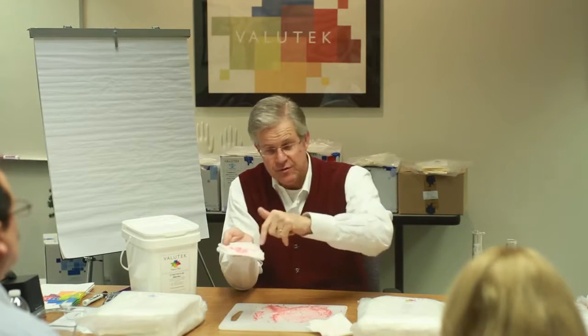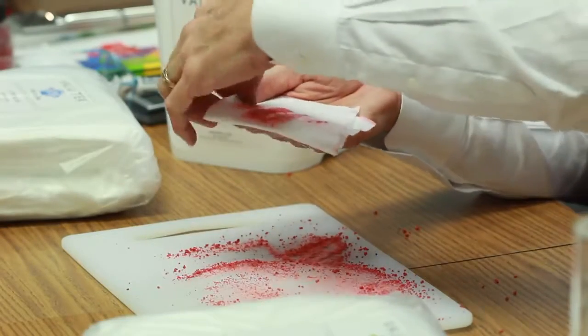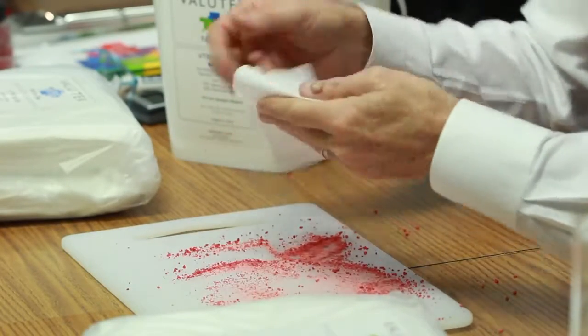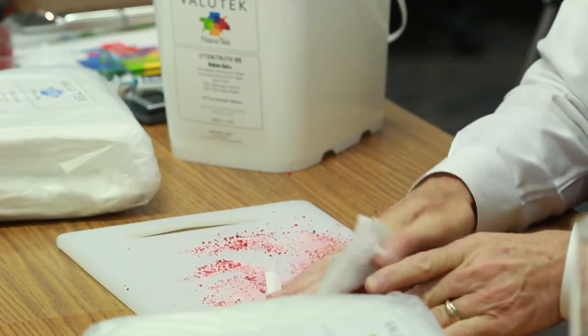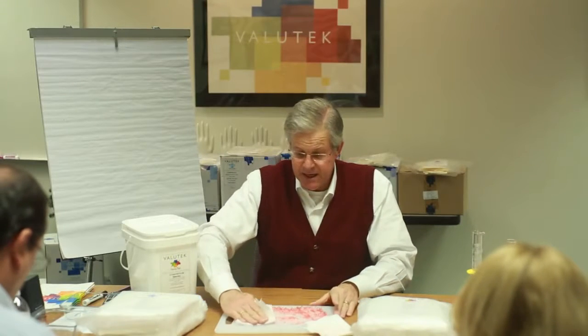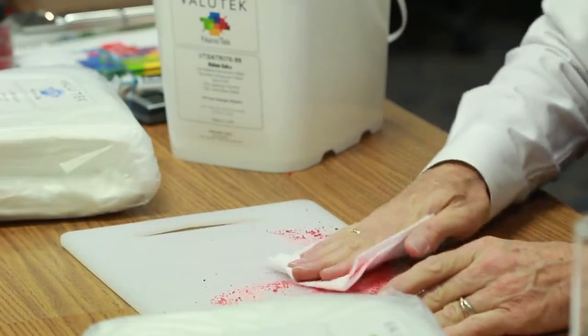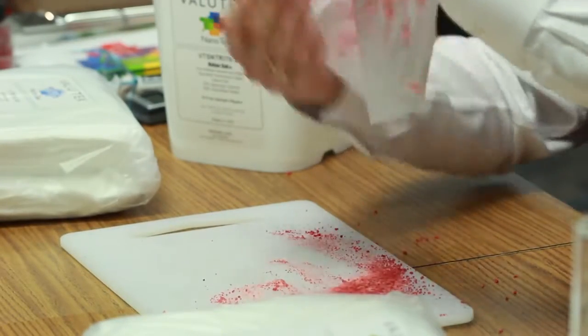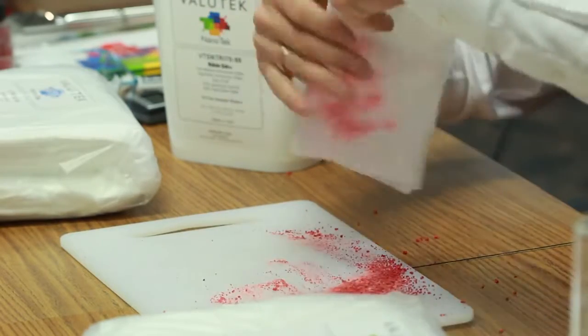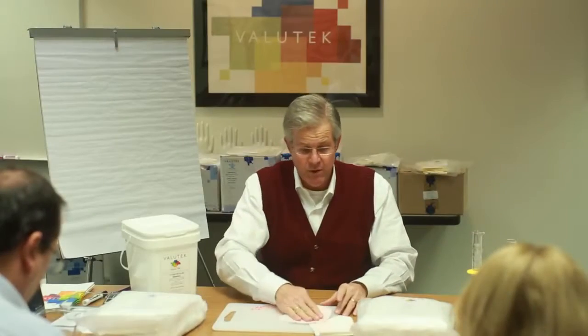Then just one final illustration. One wiper surface should have one wiper pass. So the correct way to wipe a surface clean is I fold it in quarters. So this is one pass. Then I use the back side and I get another pass. Then I take this and fold it over and I get a third pass, and then I fold it over again and I get a fourth pass. And then if I repeat this with the back side, you actually see that you can get 8 passes with one wiper surface.